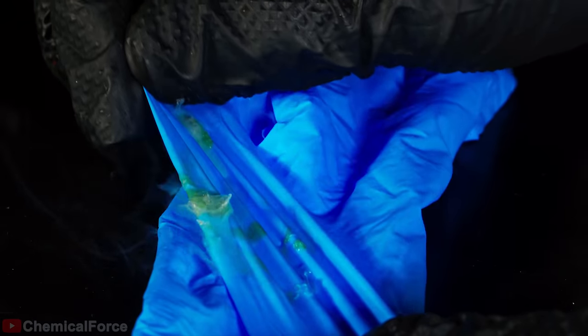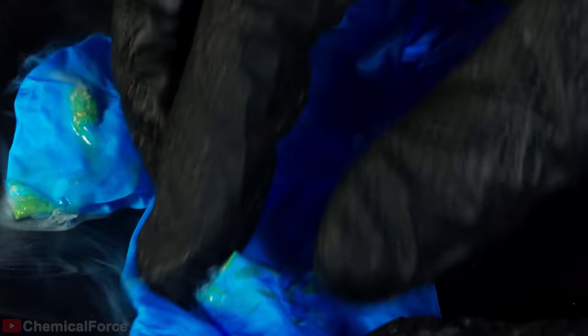Now, let's test the durability of nitrile gloves. It seems they are resistant to the effects of the superacid. Oh, never mind, they are not.